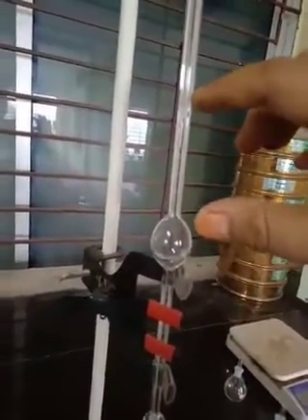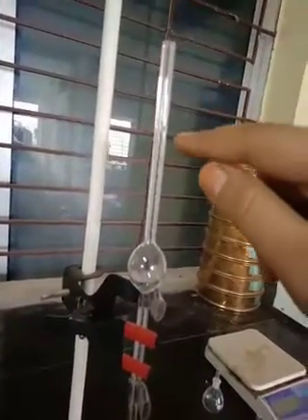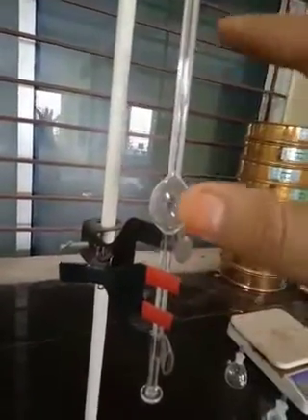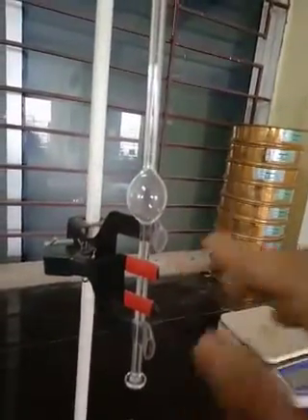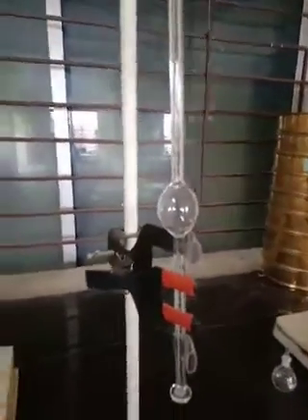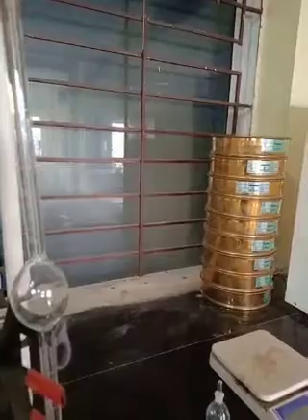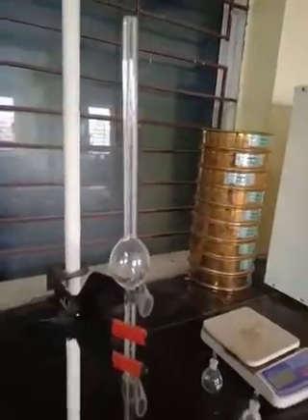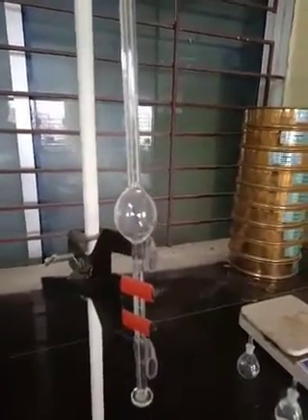We close the fingertip at the top of the tube and hold liquid up to the upper mark. When we release our finger, drops fall down one by one from the tip, and we count how many drops fall.